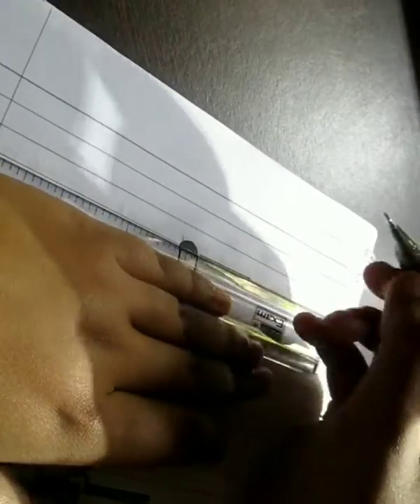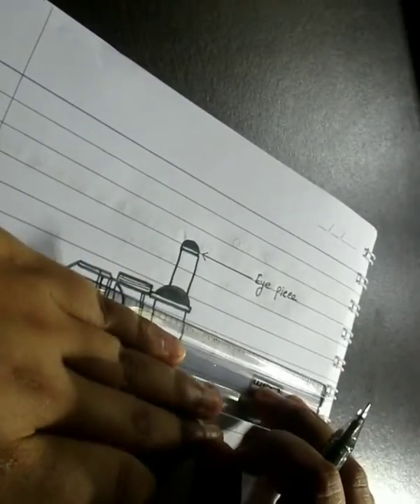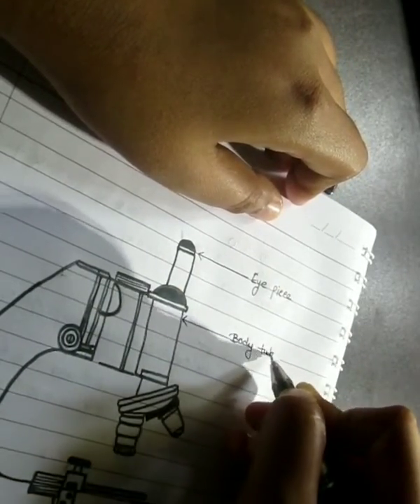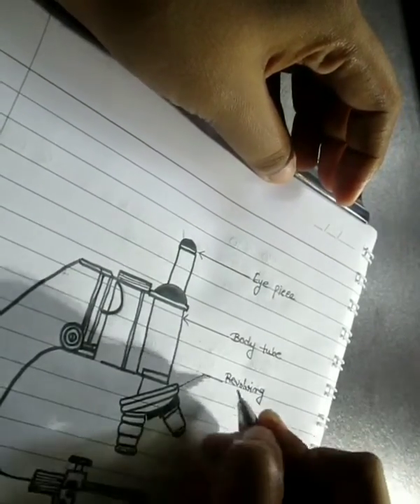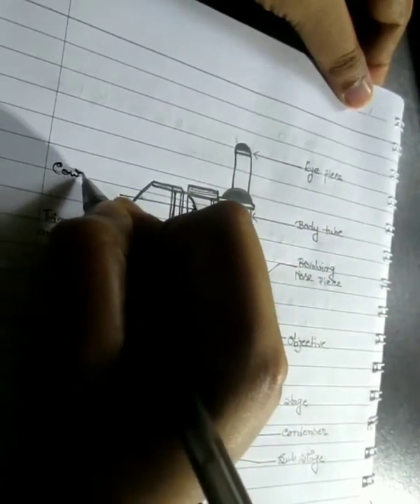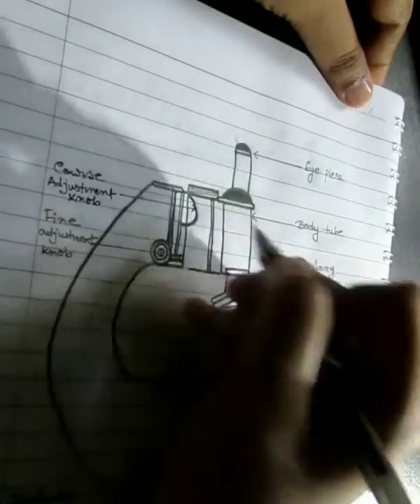A light or optical microscope uses visible light as a source of illumination. Because the light travels through the specimen, this instrument can also be called a transmission light microscope. The simplest form of light microscope consists of a single lens — a magnifying glass. A microscope made up of more than one glass lens in combination is termed a compound microscope.